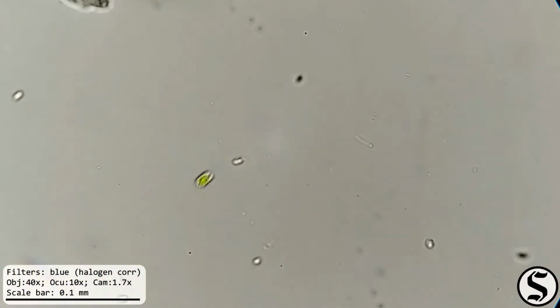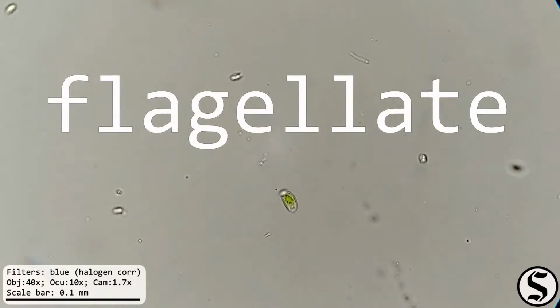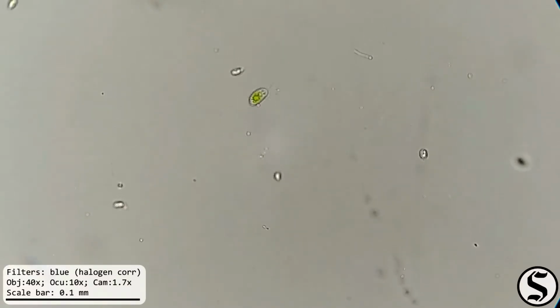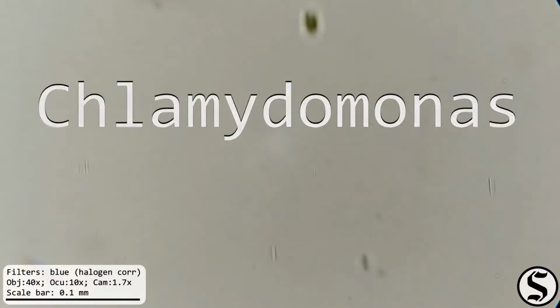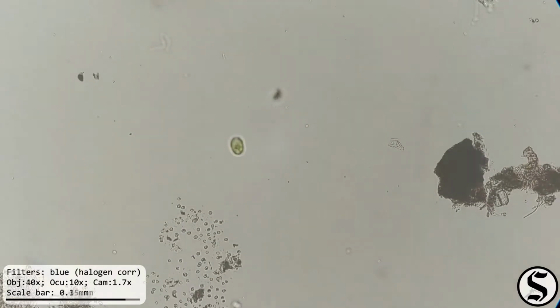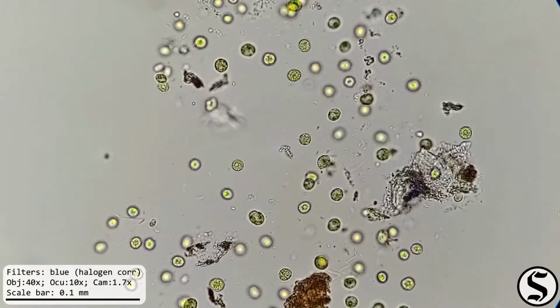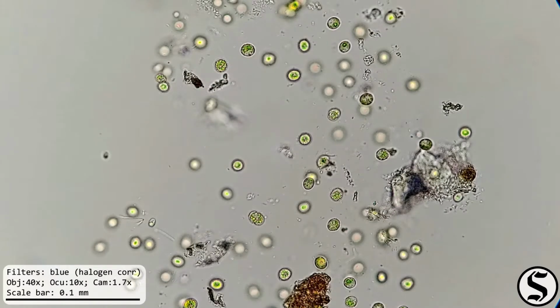Well, when I switched back to bright field, I noticed this flagellate. Recall that flagella is Latin for whip. You can kind of see its little whip going in front of it. I have difficulty with these small, fast-moving guys, but I think this might be of the genus Chlamydomonas, from the Greek chlamus, cloak, and monas, solitary. Elsewhere in the sample, green algae over here, some Chlorophyta, and some little flagellate just really twirling over there.